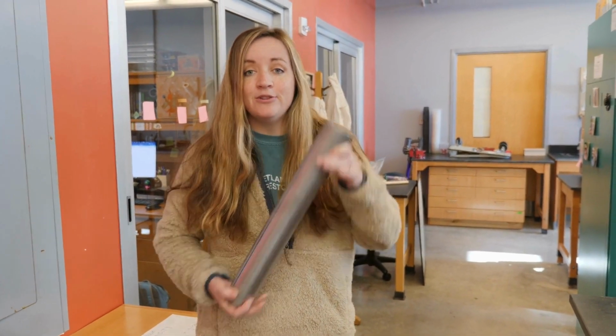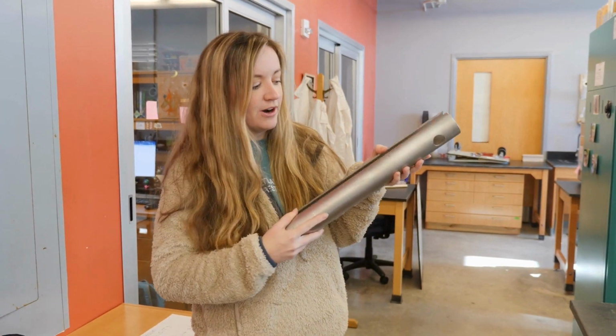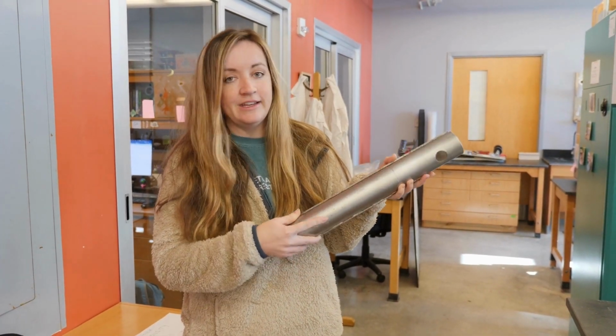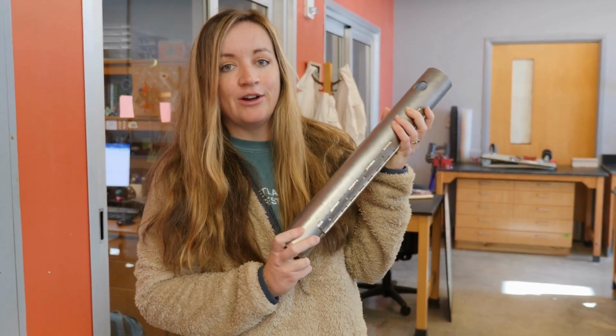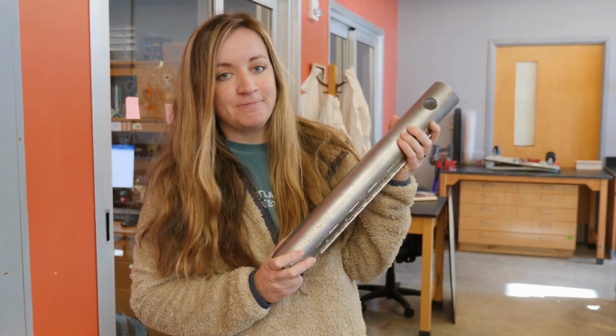So let's assume that you've already taken your soil core. What we're looking at here is a piano hinge core, and you should have a known volume of soil when you come back to the lab based on the diameter of the core and the depth at which you took it. Use a simple equation for the volume of a cylinder to figure out the volume of that soil. Should be in centimeters cubed.